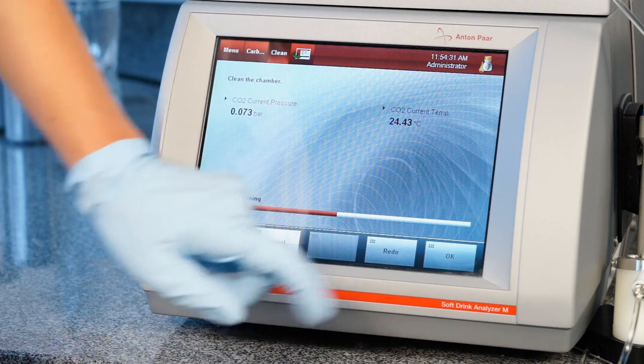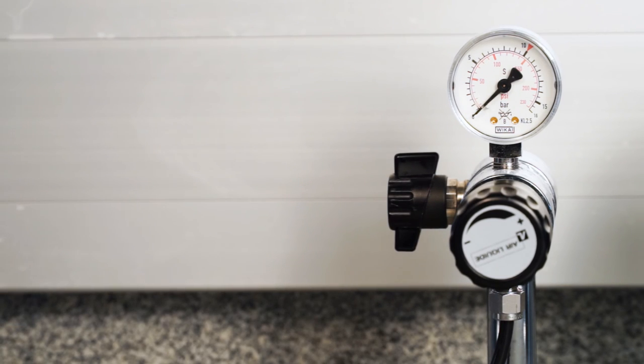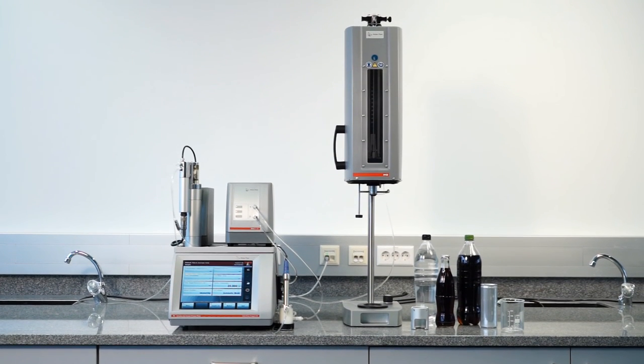In case the analysis has stopped overnight for any reason, deactivate the pressure. Now the PBA system is clean and ready for the next measuring cycle.